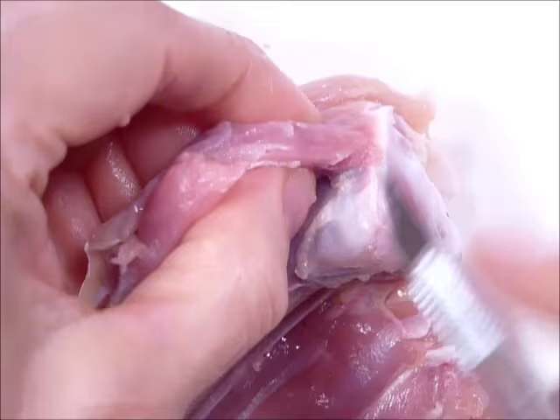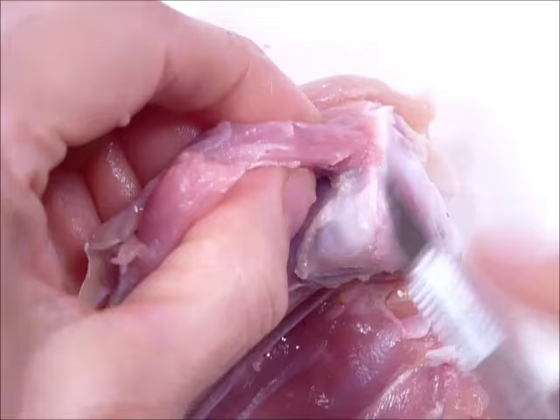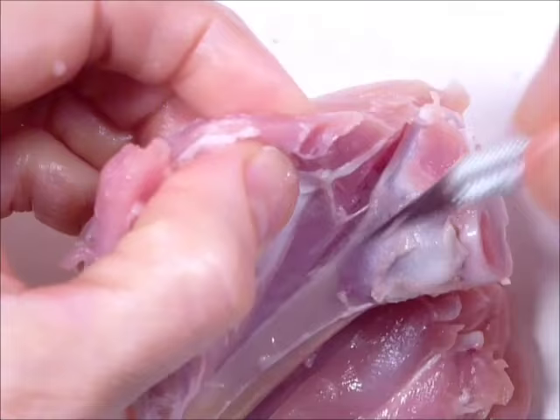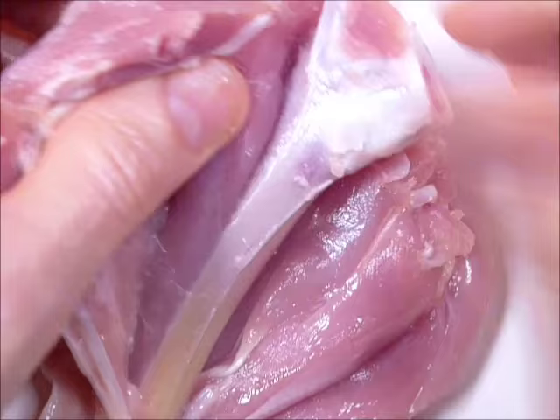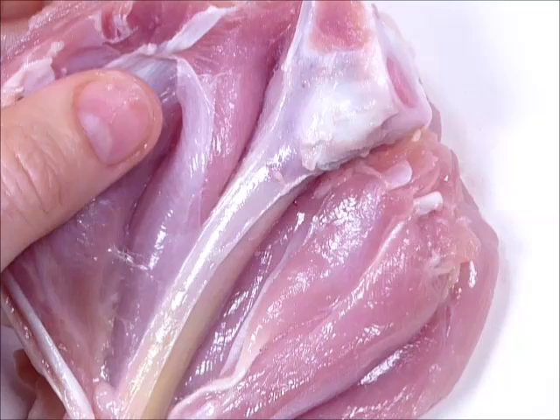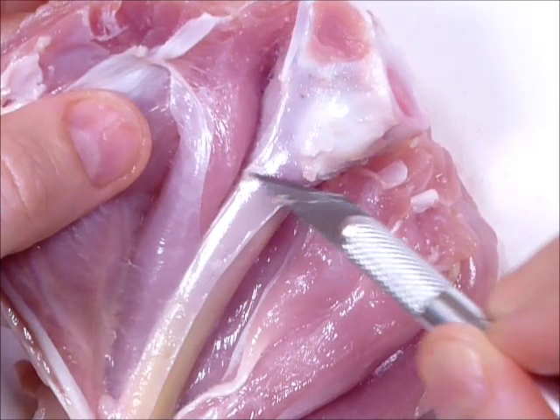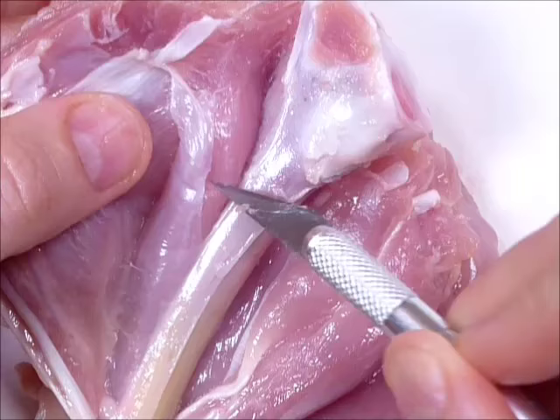Wherever it looks like muscle is attaching directly to the bone, microscopically it would still be connective tissue. Bone itself is actually a network of collagen — the difference is that the network is filled in with calcium and phosphorus and minerals that make it hard, but bone itself is made out of collagen. So it's easy for the collagen to connect to the collagen: the collagen in the bone on the outside can connect to the fascia because it's all collagen, all compatible tissue.